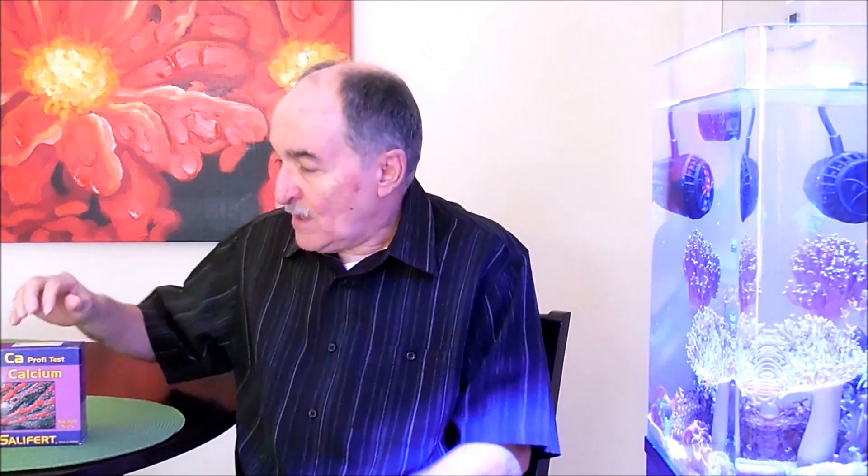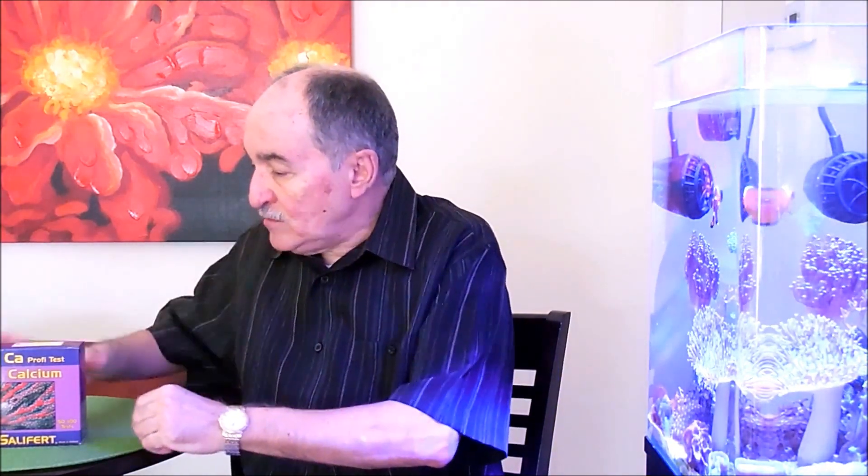Hi fellow reefers, this is Eddie of Eddie's Reef Aquarium. In today's video I'm going to go over a demonstration of how to use the Salifert Calcium Test Kit. Very simple, very easy, and not as complicated as some people might think it is. So here we go.